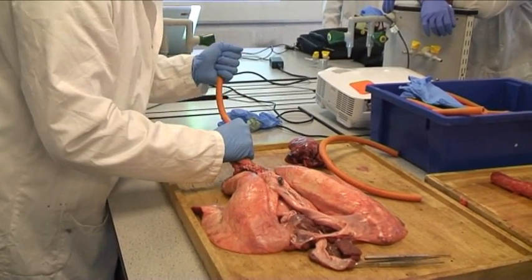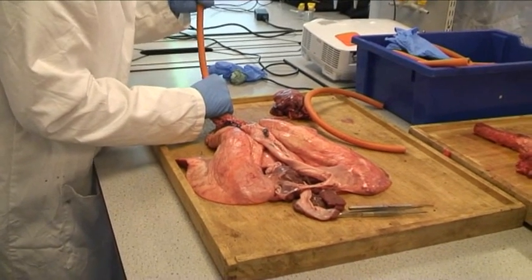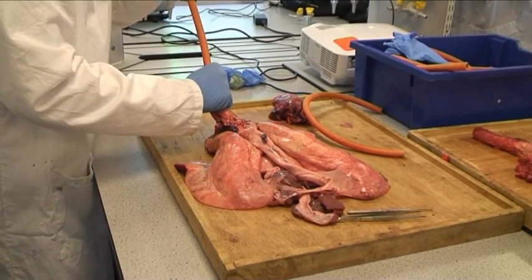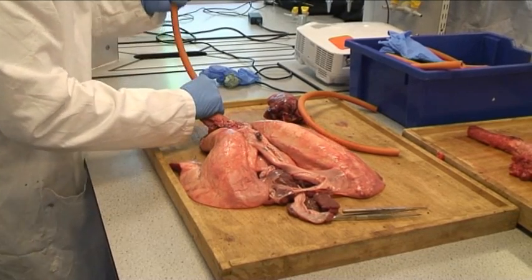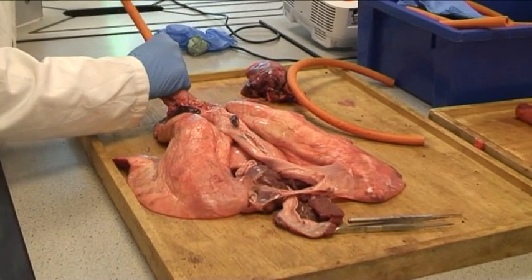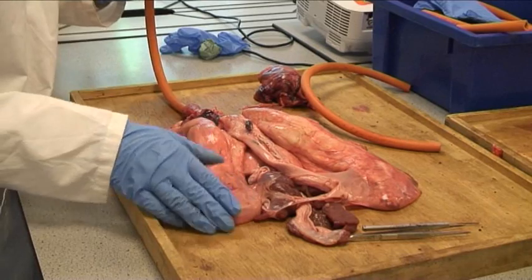Okay, there you go — lungs inflate, and we're going to go again. Ready? Three, two, one. Okay, we'll go for the third attempt and then we'll just have a look at this over here. Three, two, one — the lungs expanding, you can see the feel of the lungs.